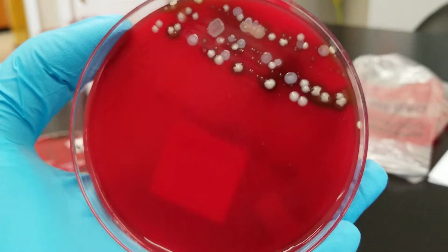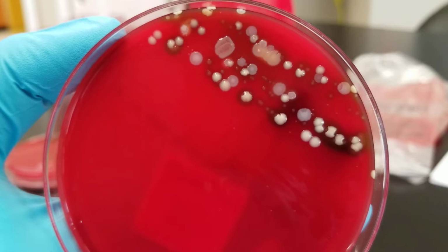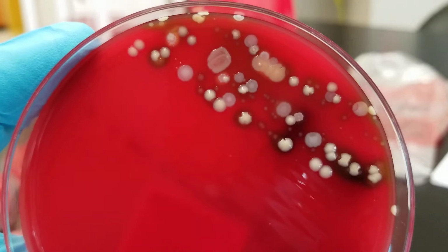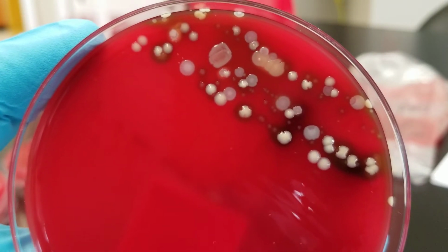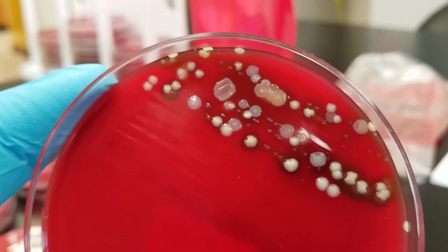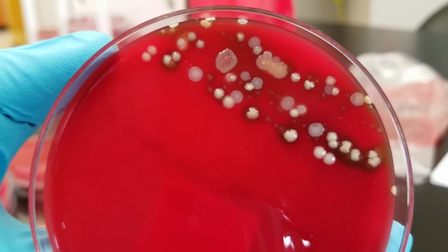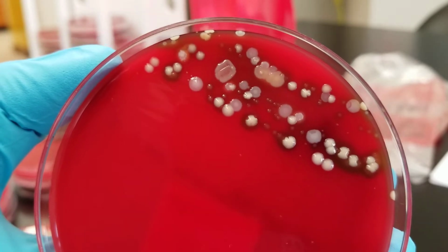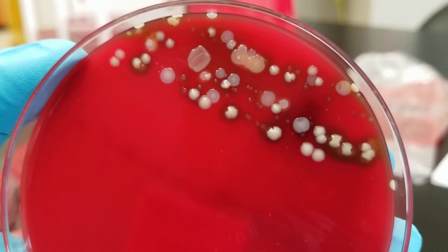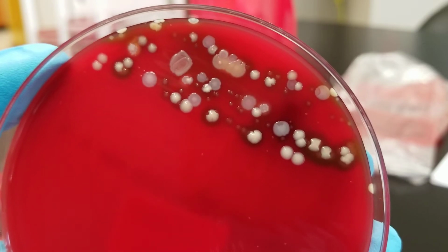It's on a BAP and we have some growth here. We have a few different organisms here. It looks like we have about 3. And there is a concern here about possible MRSA. So we isolated the staph. If you look, the gray ones look like staph, could be Staph aureus. So we're worried about methicillin resistant Staphylococcus aureus. And that is what the physician wanted to find out if the patient actually had.